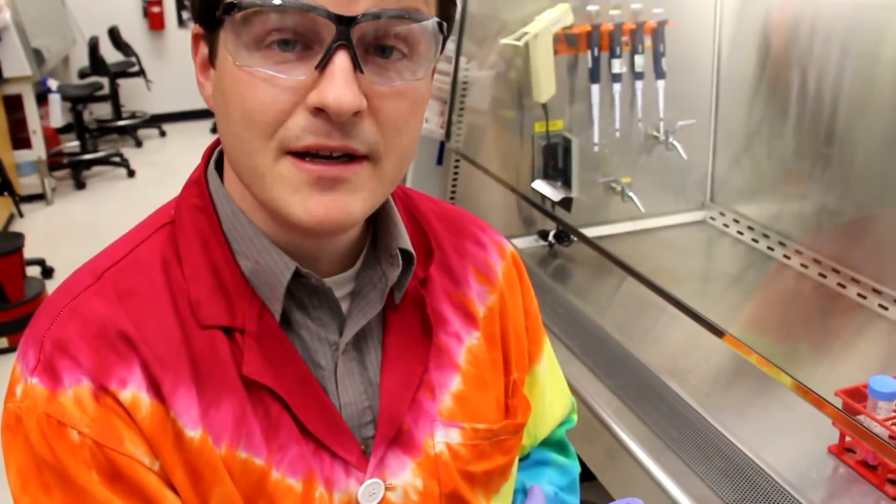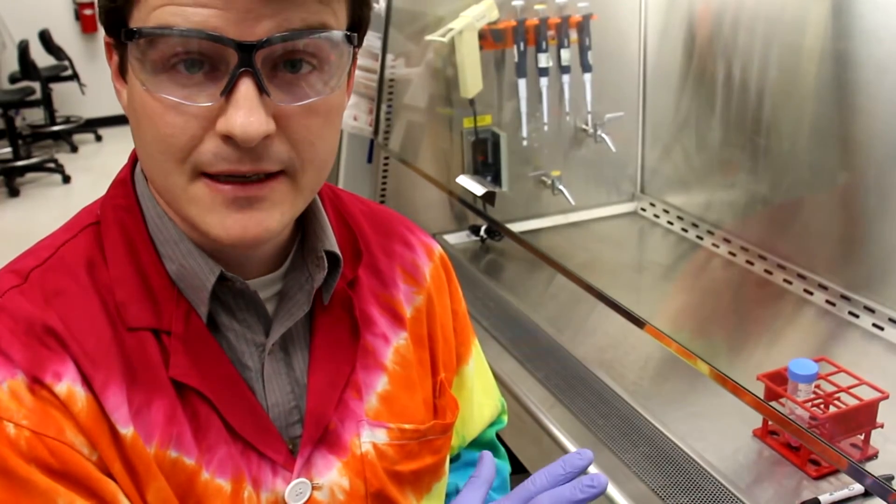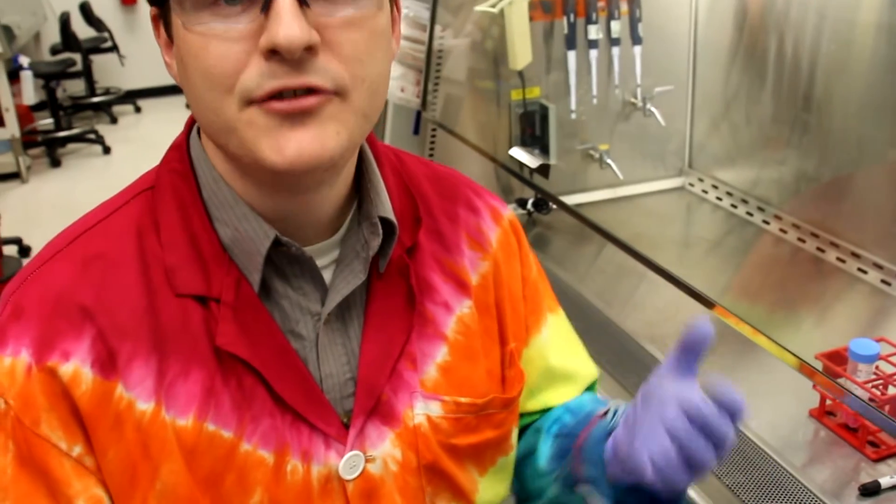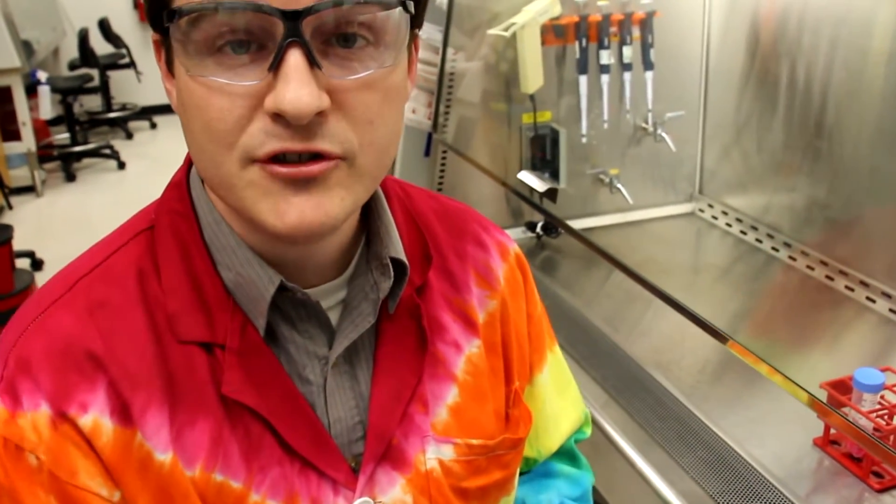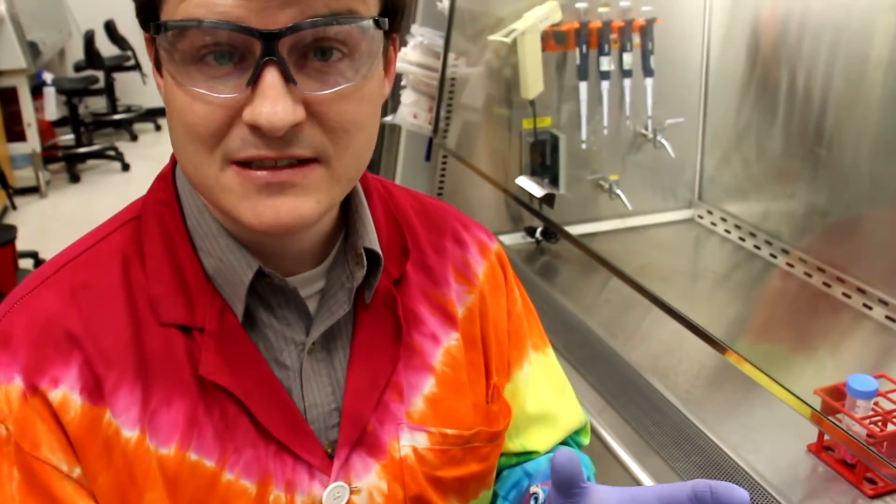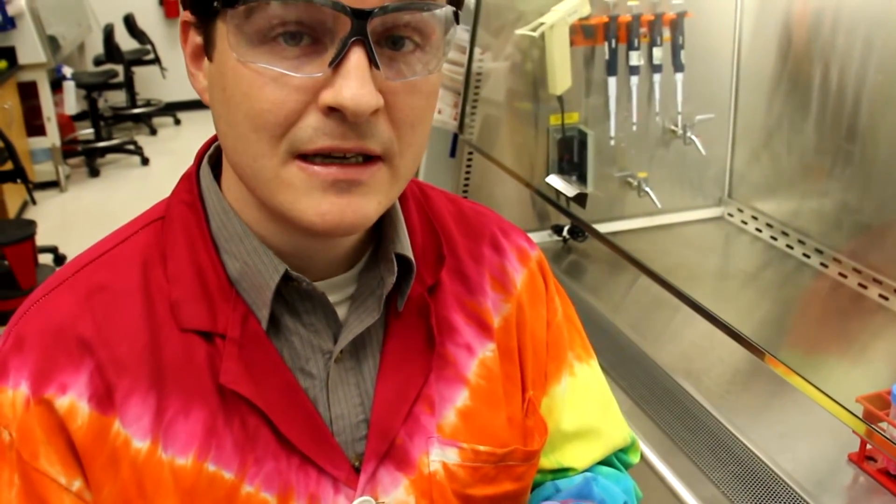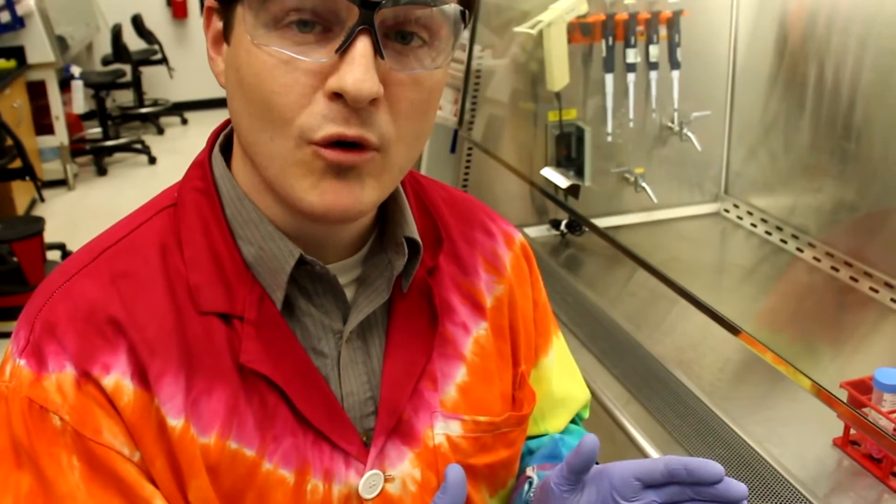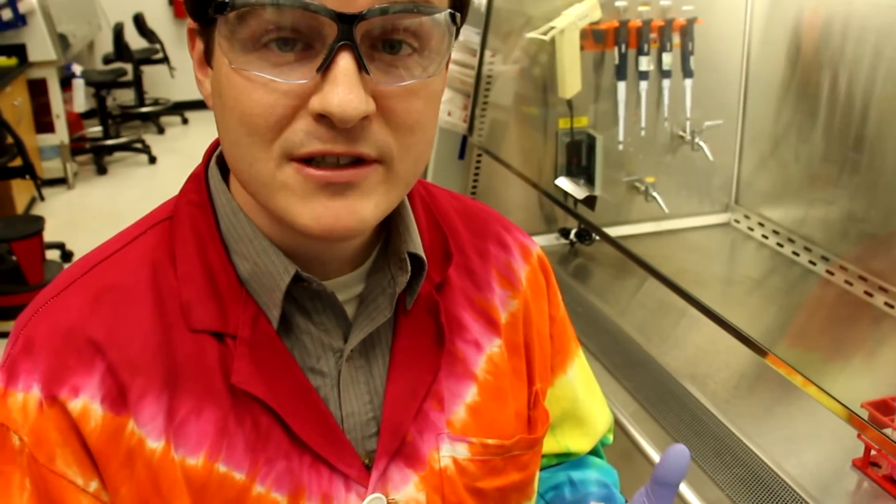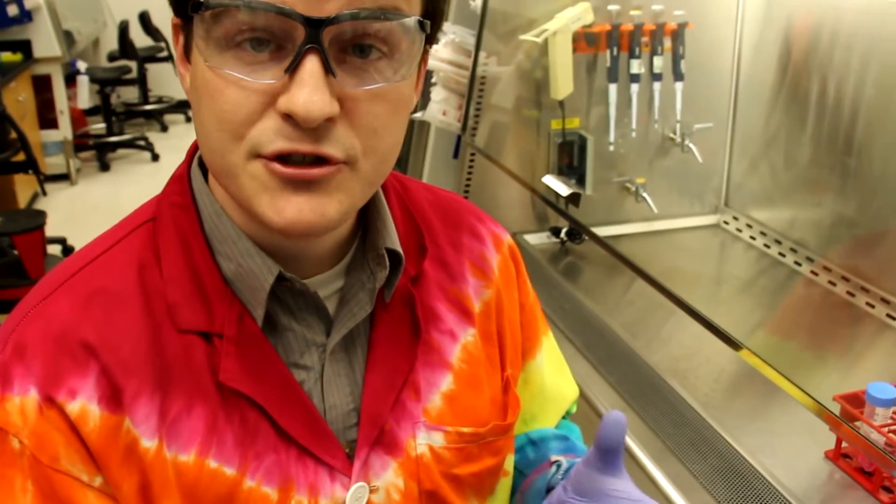Now we've placed the media and the cell cultures in the hood, and these are the only agents we're going to need for the procedure we'll be performing today. In the case of your particular lab, the instructor may direct you to include more materials, or you may need to introduce more materials into the hood. In any of those processes, to preserve aseptic conditions, you want to have those materials ready in advance and move them all in the hood at one point in time. You want to spray them all down with ethanol, and in doing so, you've now prepared a clean container in which you can work with your cells.